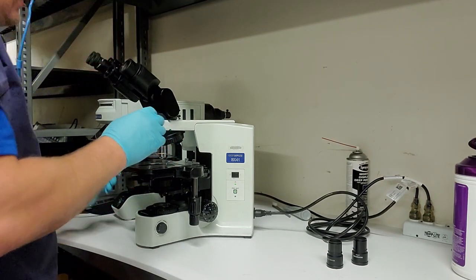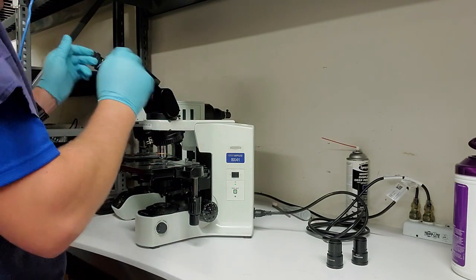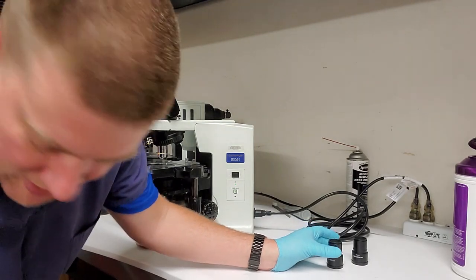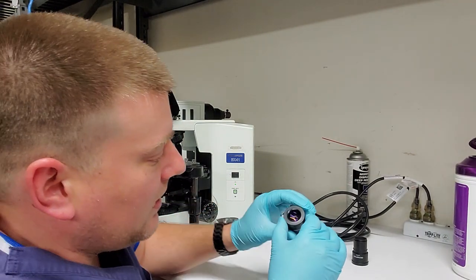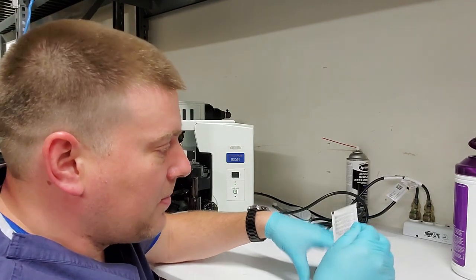Now these ones here look like they're very clean. The tube where the oculars slide in looks very clean. So I'm going to be very careful not to touch that again. And I'm going to open up a Zeiss wipe.